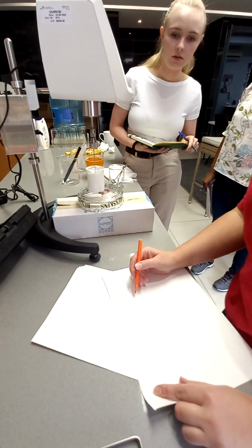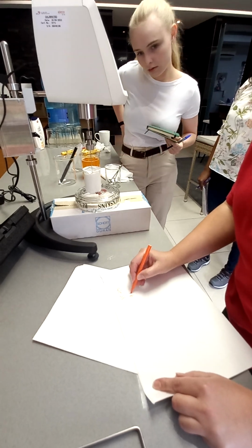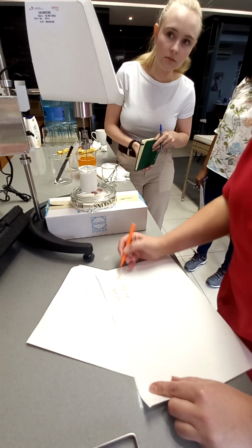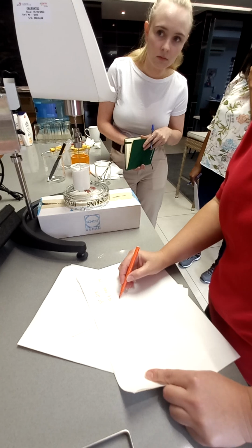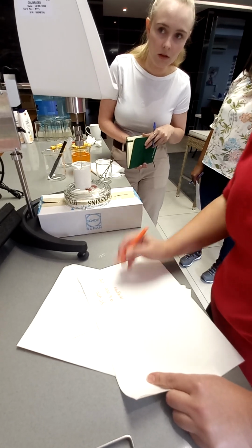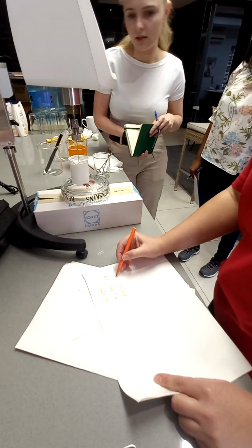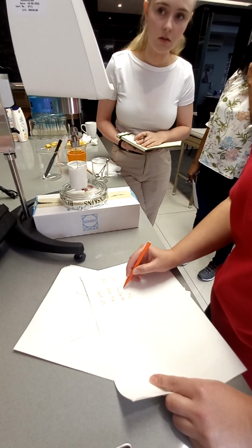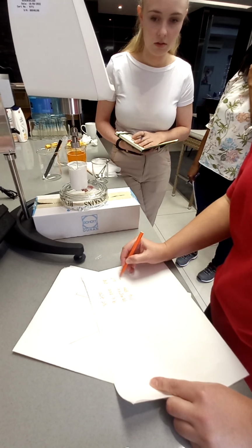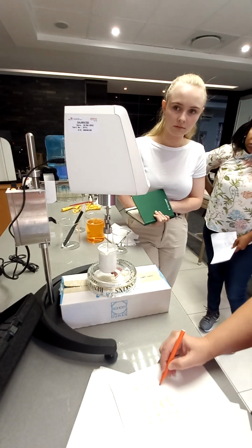So let's take another reading. What was it? 91, you said? 96. 38%. So that's 50% off. So, 106, let's do 109,500. Actually, you should get nice increments. Yeah. Now, this is just for training. That was 43%. Okay, 43. 114,800. 46. Let's see, has it gone up? Not yet. 116,800.